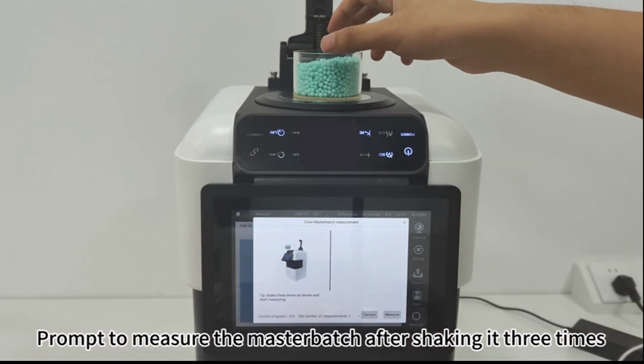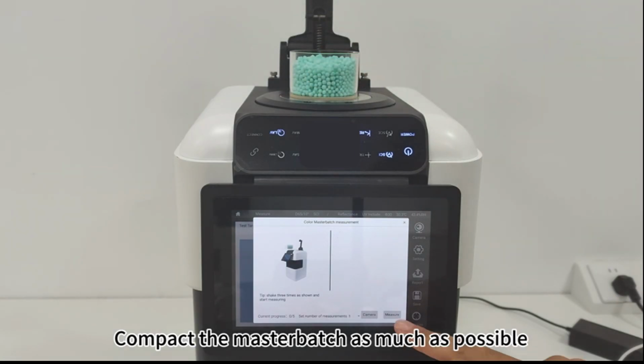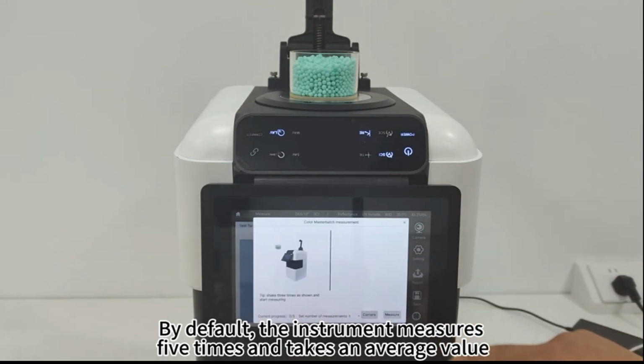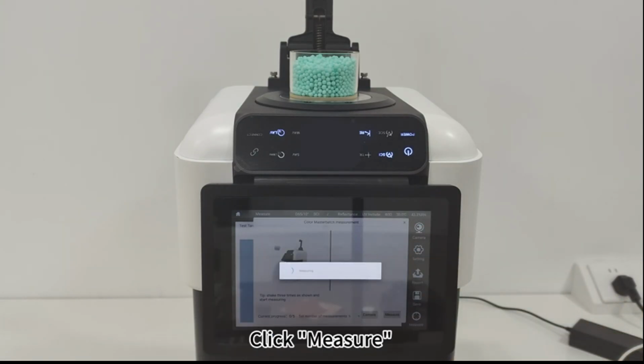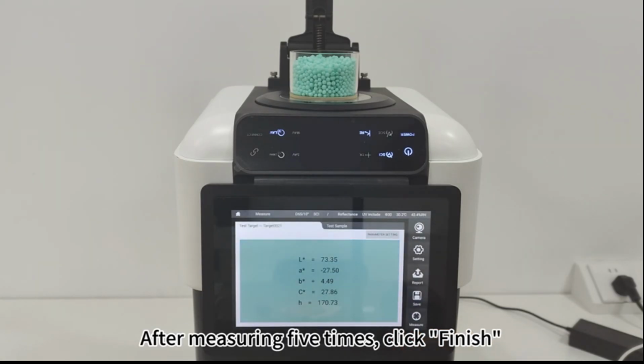Prompt to measure the master batch after shaking it 3 times. Compact the master batch as much as possible. By default, the instrument measures 5 times and takes an average value. Click Measure. Second measurement, third measurement, fourth measurement, fifth measurement. After measuring 5 times, click Finish.